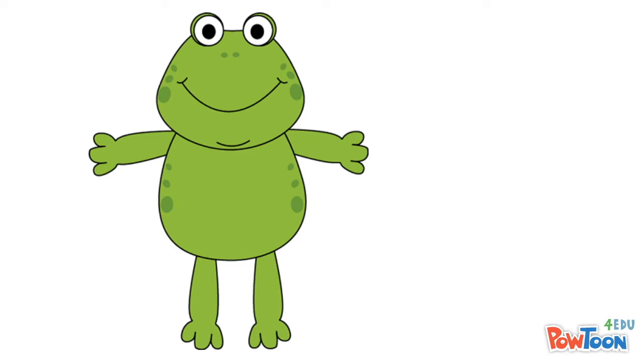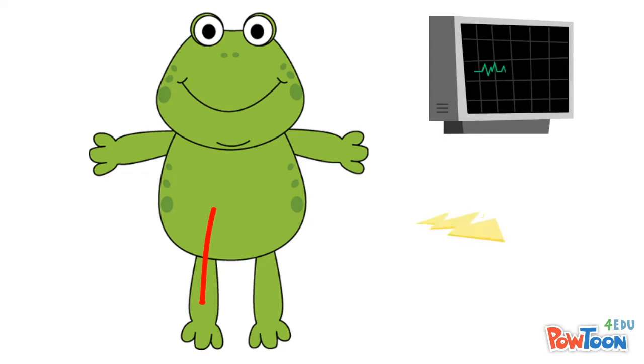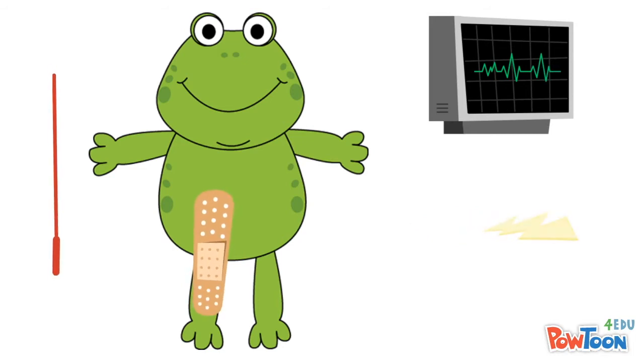Today we will share with you the effects of temperature on the sciatic nerve of a frog. The sciatic nerve is used to demonstrate the ways in which neural processes and conduction change with varied temperature.